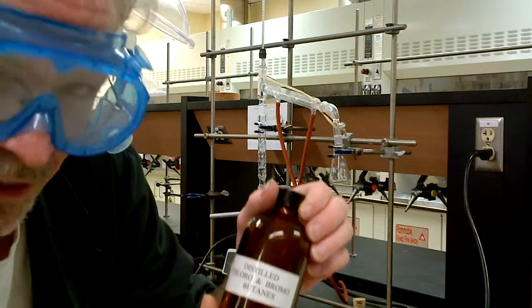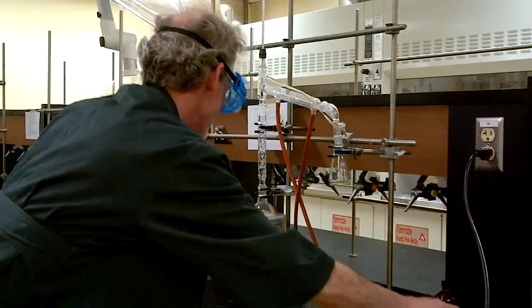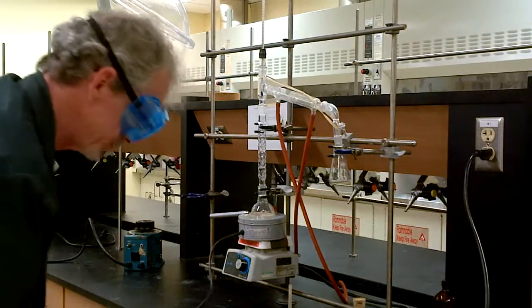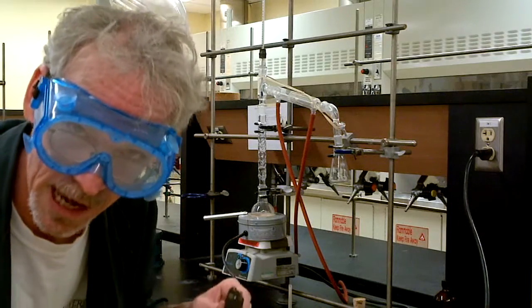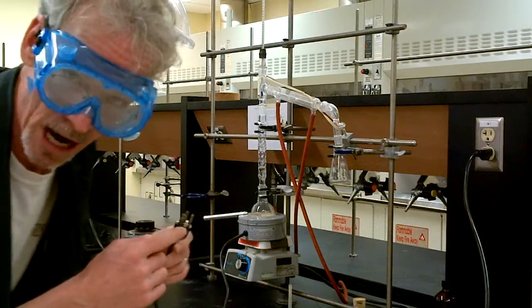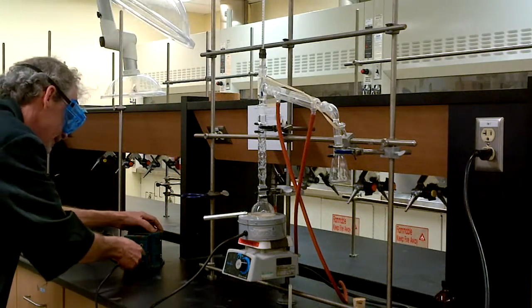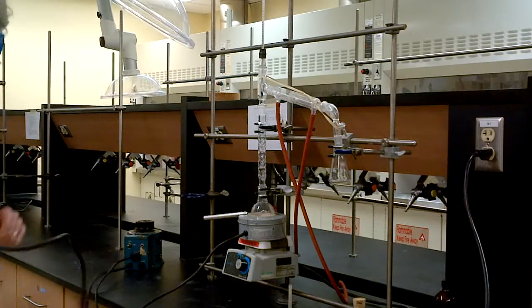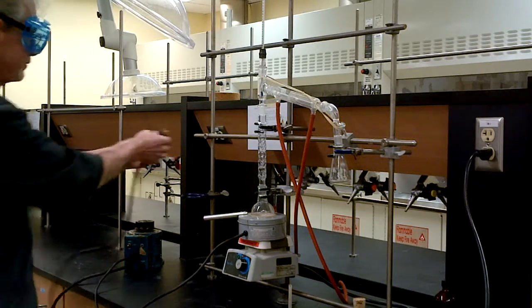And if you don't have enough product for the distillation, I just happened to save it from previous years so we can give you something. Here we go. Let's start our stirring. The heating mantle is plugged into the power supply, the power supply is plugged into the wall.